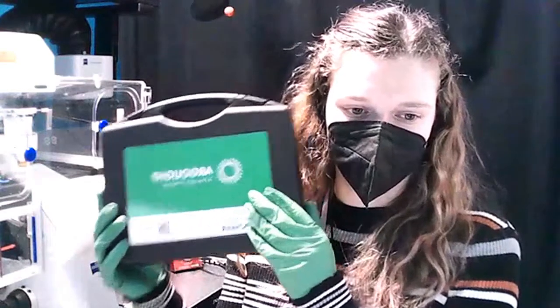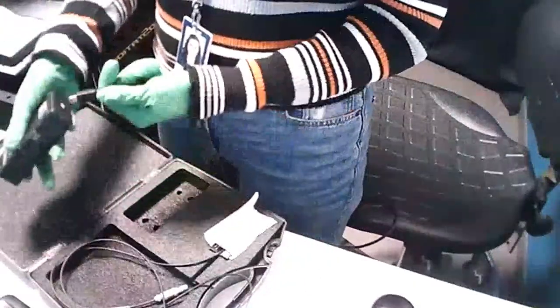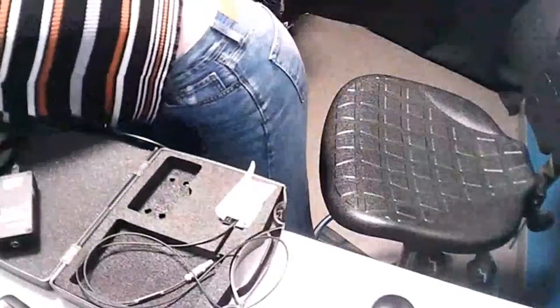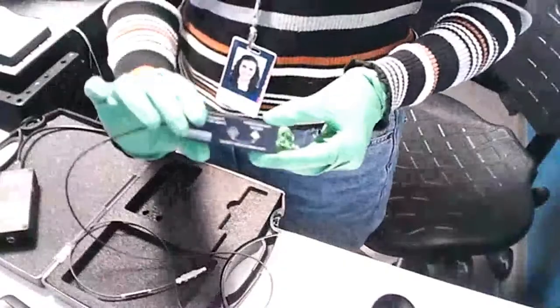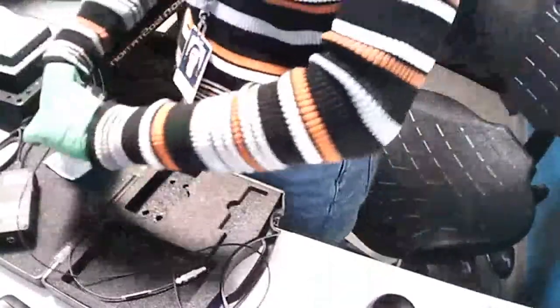The ArgoPOWER HM slide requires some assembly before it can be used on our system. We want to plug the USB into the spare USB port on our acquisition PC. We also want to make sure we handle the ArgoPOWER HM measurement slide with care.